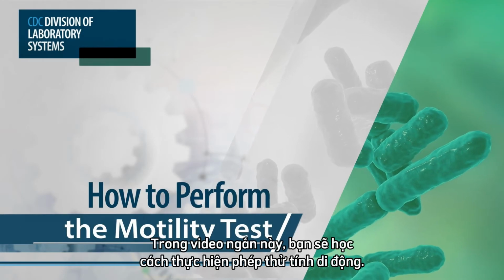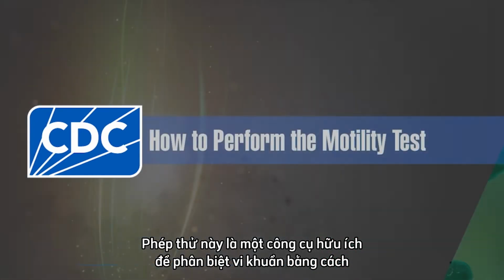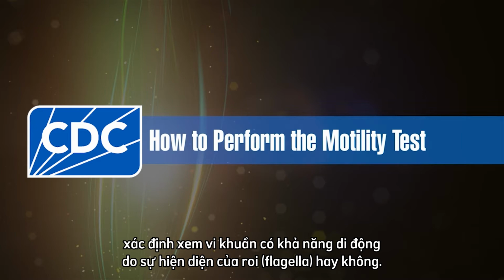In this short video, you will learn how to perform the motility test. This test is a useful tool to differentiate bacteria by detecting if a bacterium is motile due to the presence of flagella.